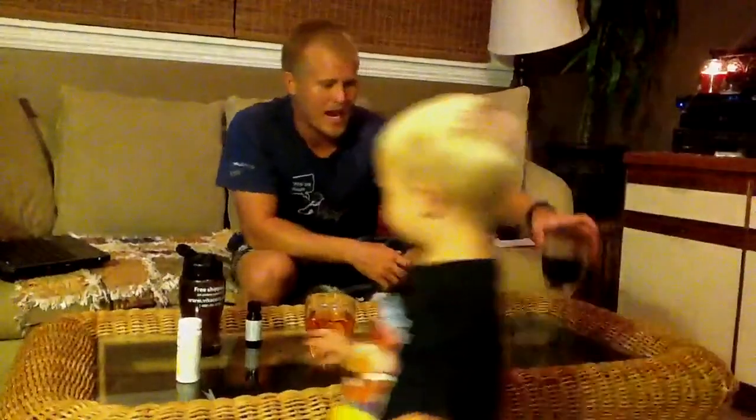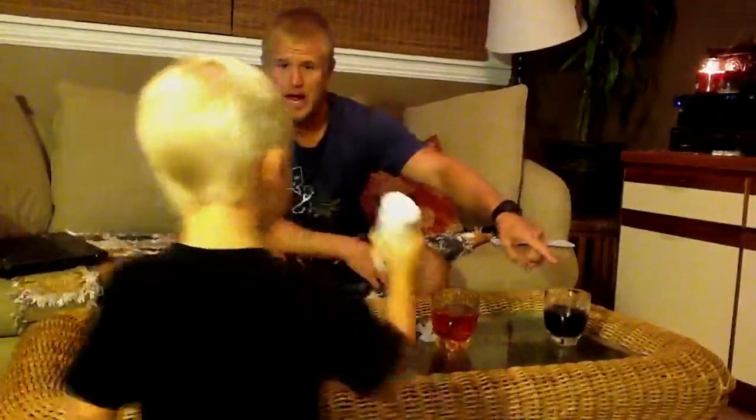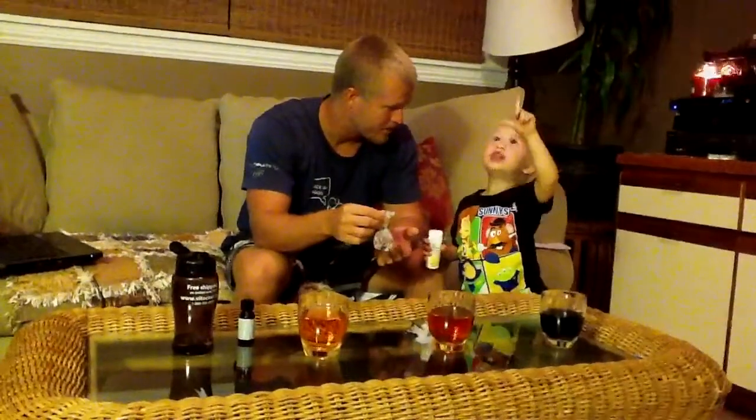before I start the experiment, I would ask the students what's going to occur. Let's make some predictions. What do we think is going to happen? We already know what happens when iodine and cornstarch mix. But this is sealed in Saran wrap. How is it going to go through?